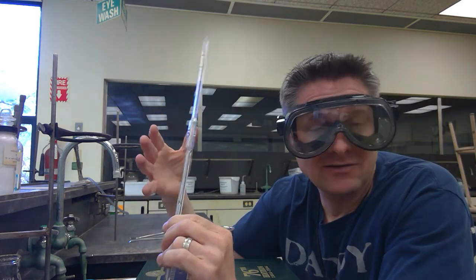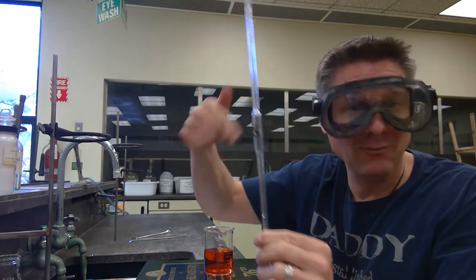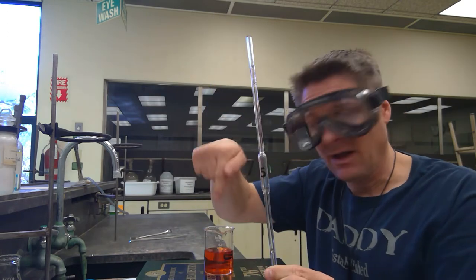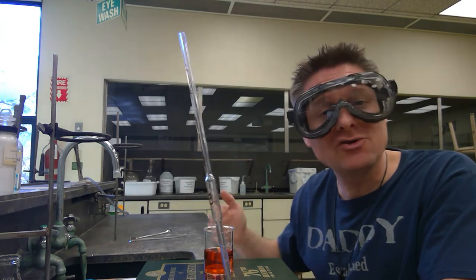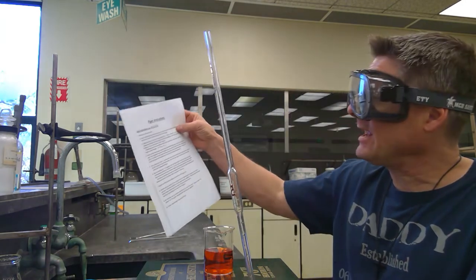If it was another solution, I'll probably clean it out with DI water first to get all that solution out. Then I would condition four times with the new solution to replace the DI water coating. You could also clean these out with DI water, hook it up to an aspirator — which we have on our sinks — like a vacuum, and dry it out that way if it needs to be dry. But you should usually be able to condition it — always check your instructions. Make sure your pipette's clean and conditioned.